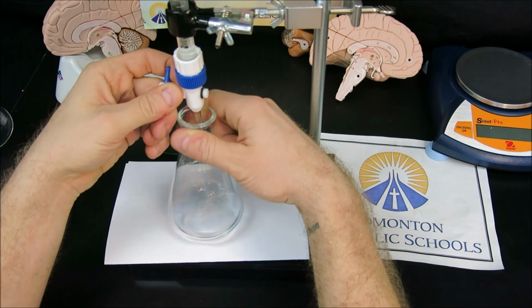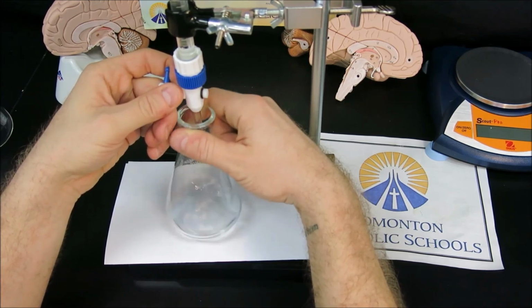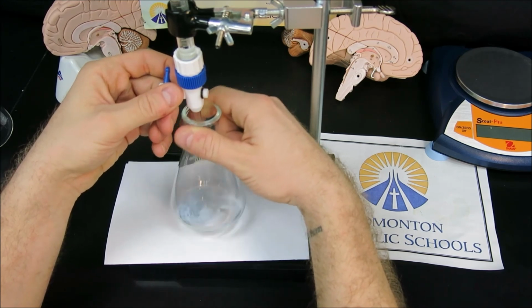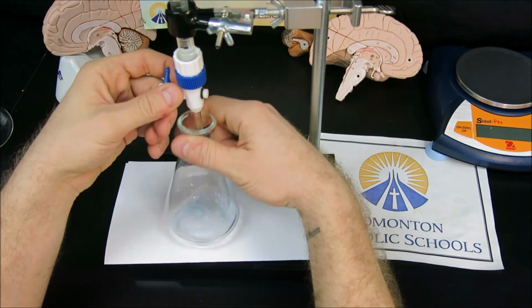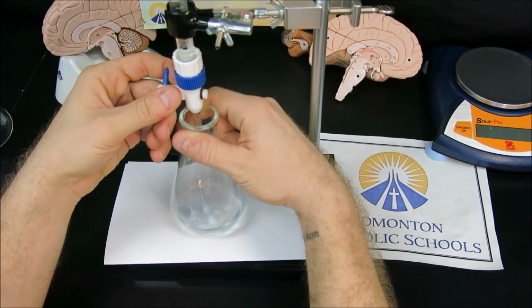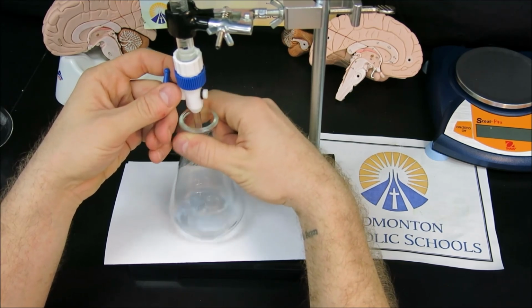We'll try and make a faster drip rate here. It's important to be watching the color change very carefully. If the fading of the color change is occurring slowly, that indicates that we're getting closer to our equivalence point and closer to our endpoint, which is a color that's green.